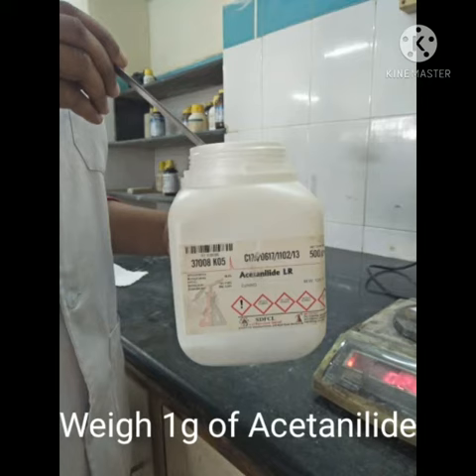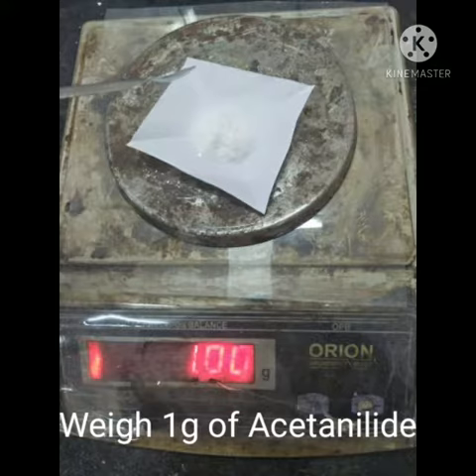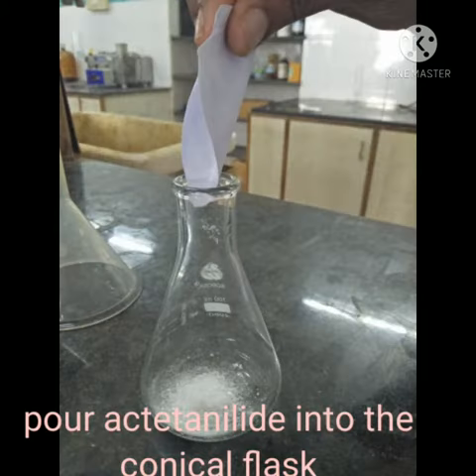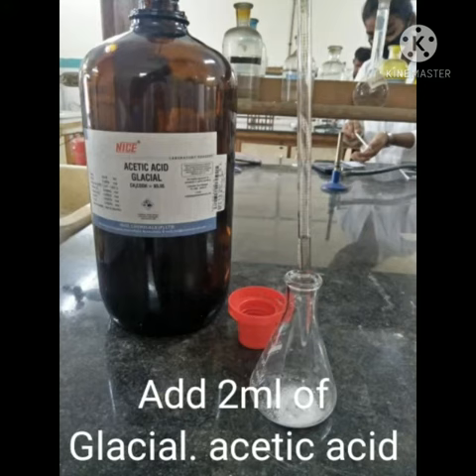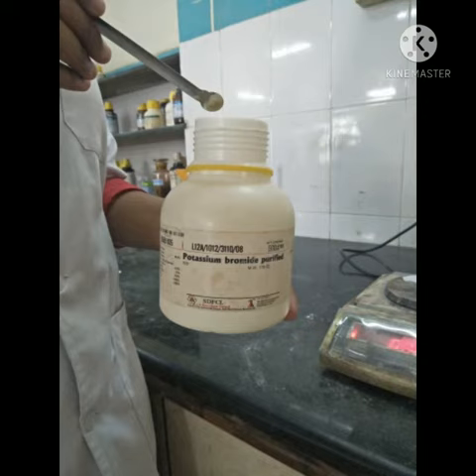Take 1 gram of Acetanilide and pour into the clean conical flask. Dissolve the Acetanilide by using Glacial Acetic Acid.